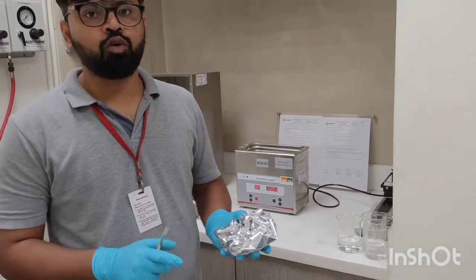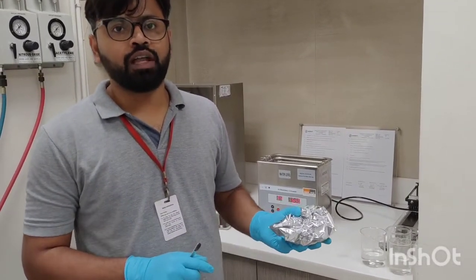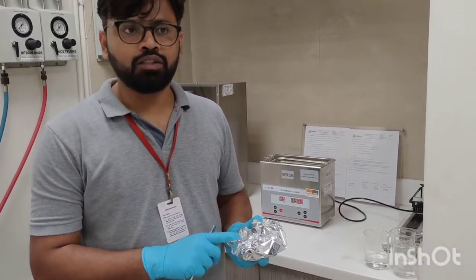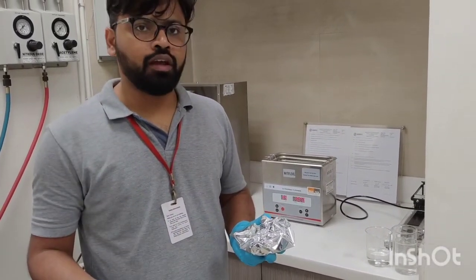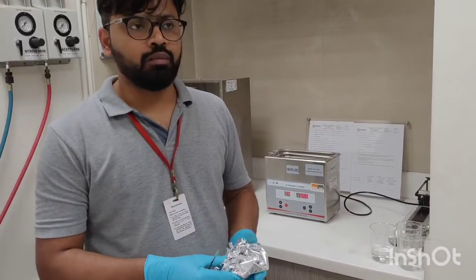In case if you are not having an oven, you can just keep it in air for 10 to 15 minutes, then the solvent is going to evaporate by itself. Now we can use these parts to assemble the ion source again and to fix it in the GCMS and start the GCMS.